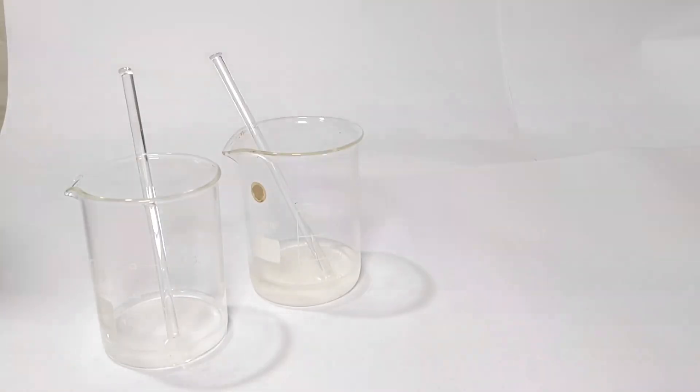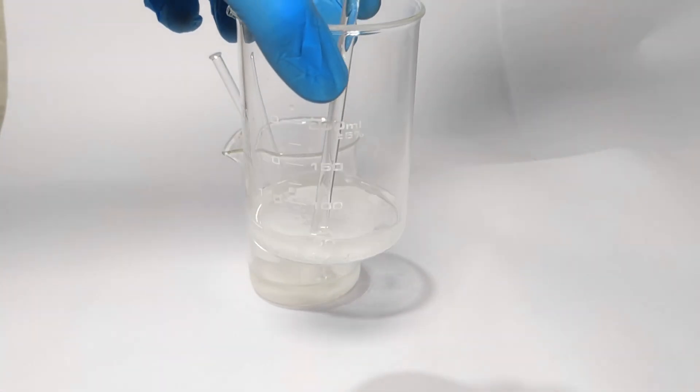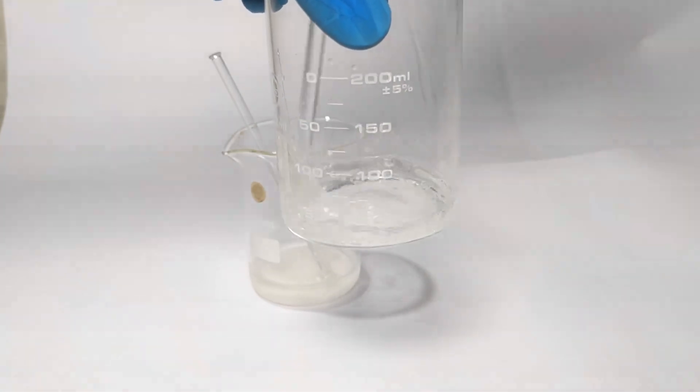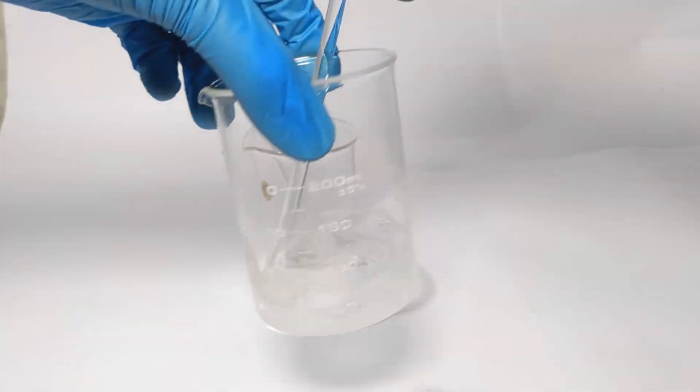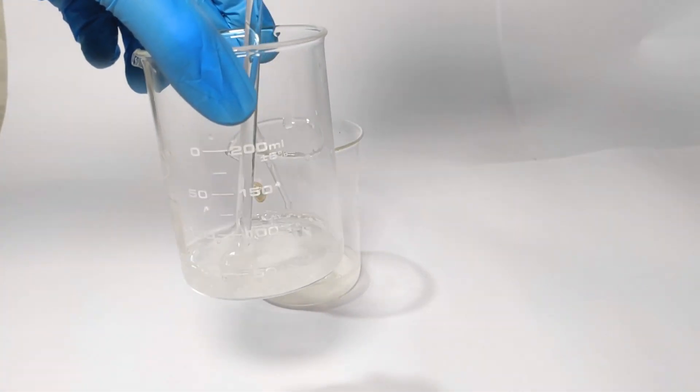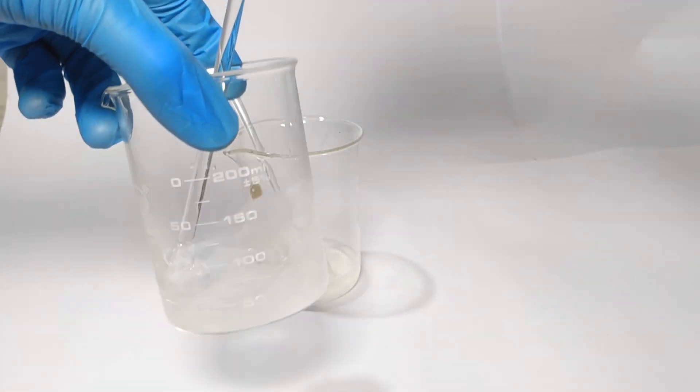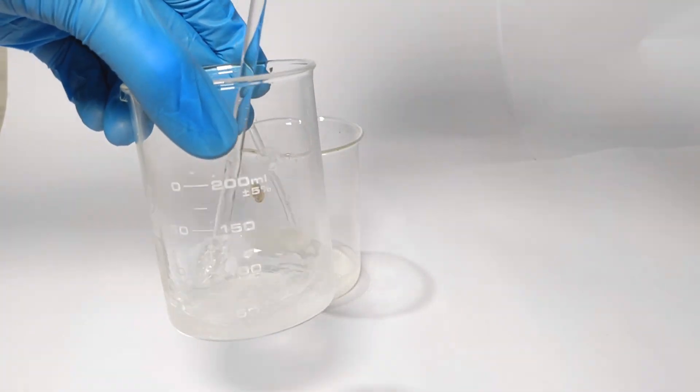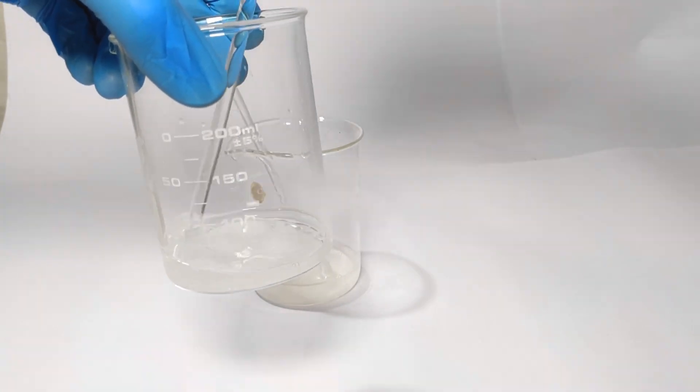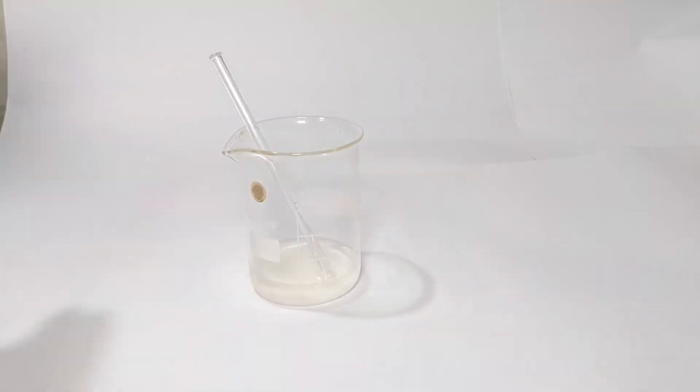Both the solids were stirred well to dissolve them in water. If you find it difficult to dissolve them, gentle heating could be done. In my case heating was necessary.